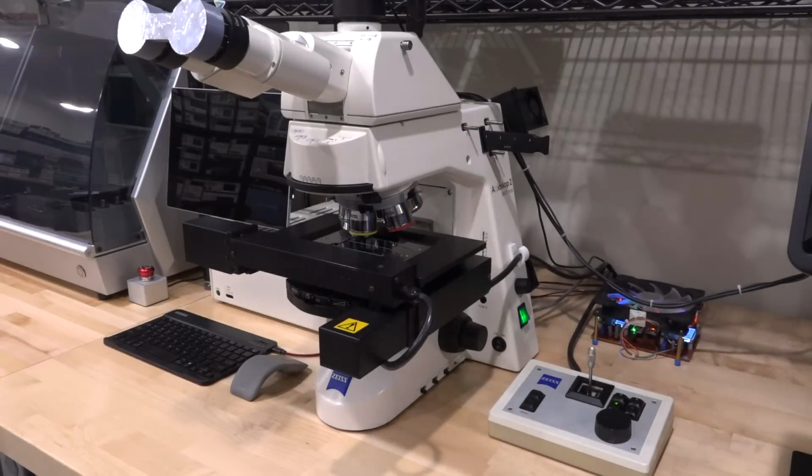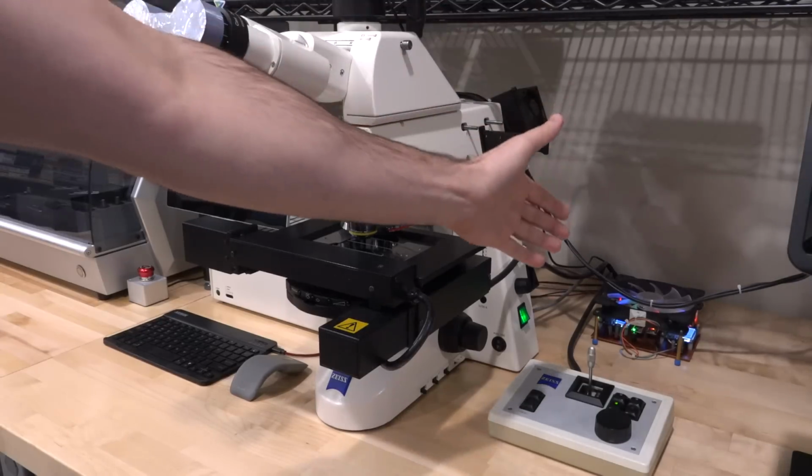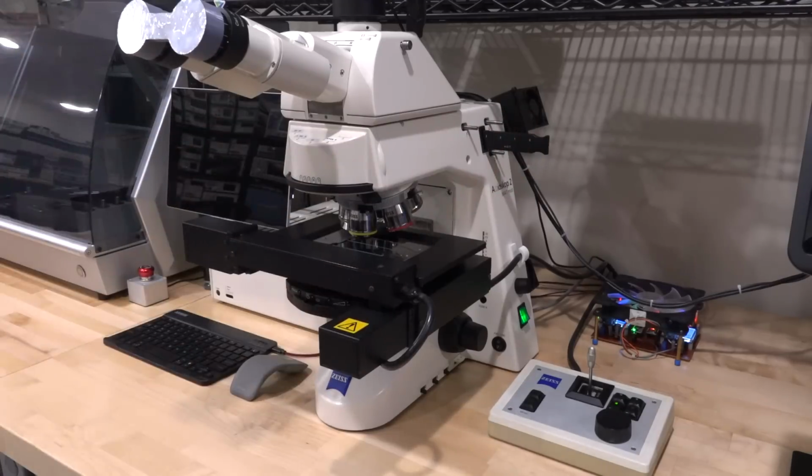In this episode, we're going to continue our work on this microscope as it has allowed us to capture some really wonderful images, especially of integrated circuits and various specimens. Now, in the previous videos, we've done the LED replacement and upgrade of this microscope. We have designed a custom power supply that you can see all the way back there that controls the LEDs of the microscope in conjunction with the built-in functions of the microscope itself, making it all a nice self-contained unit.